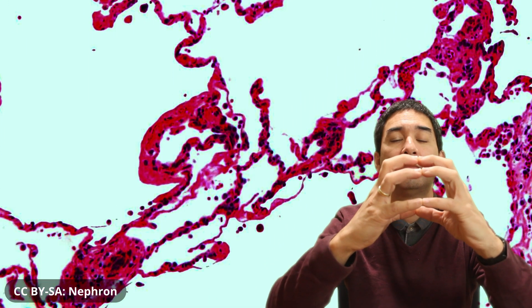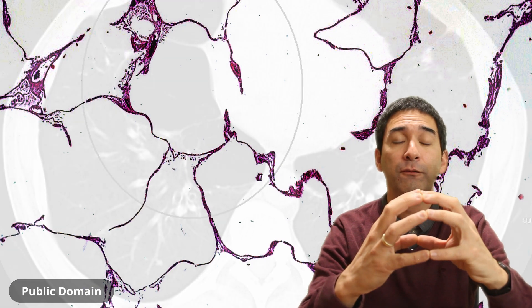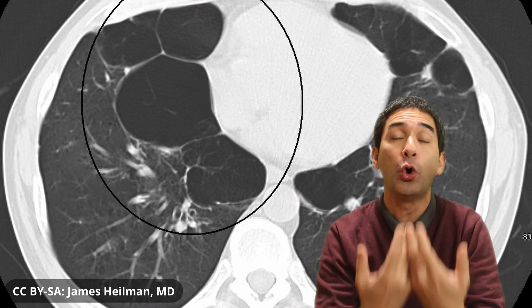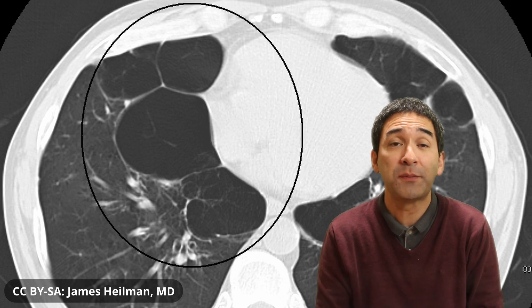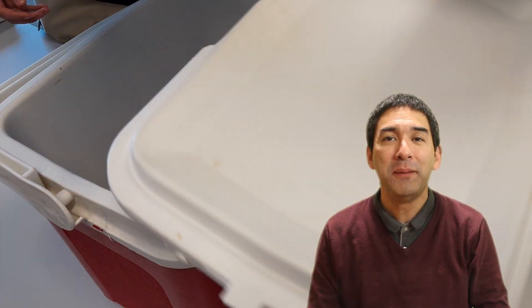This larger alveolus has a lower surface area to volume ratio, which is a problem. Even though the air space is larger, there is less wall around it with blood vessels, so the lungs are not able to absorb as much oxygen. This disease is also known as emphysema, and it's actually one of the most preventable respiratory illnesses there is.